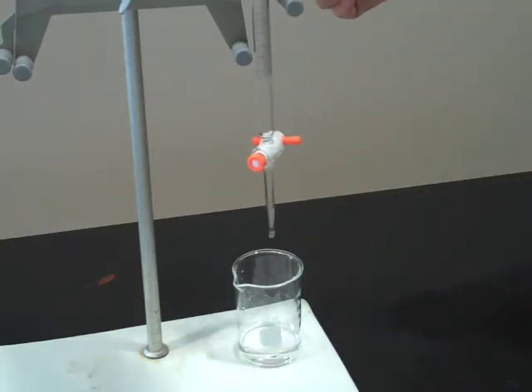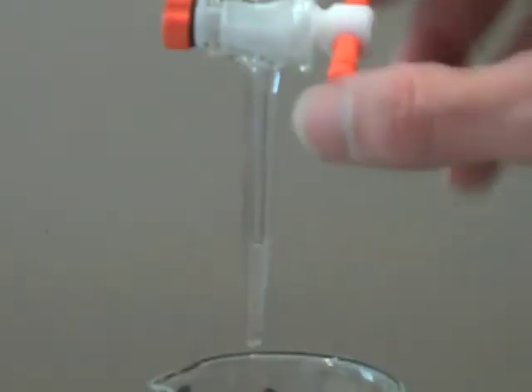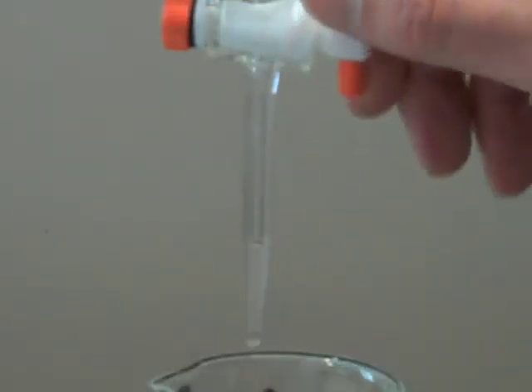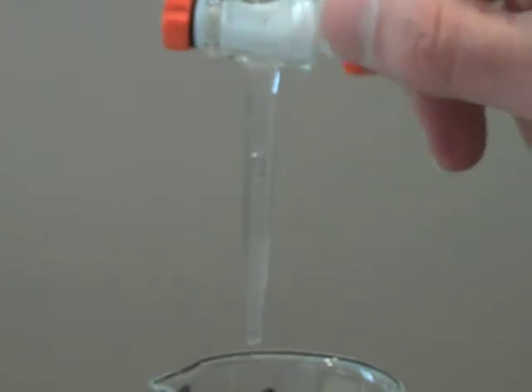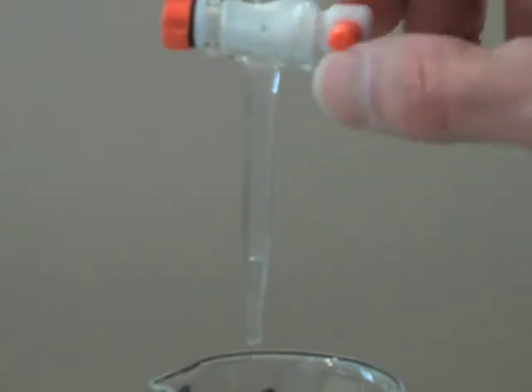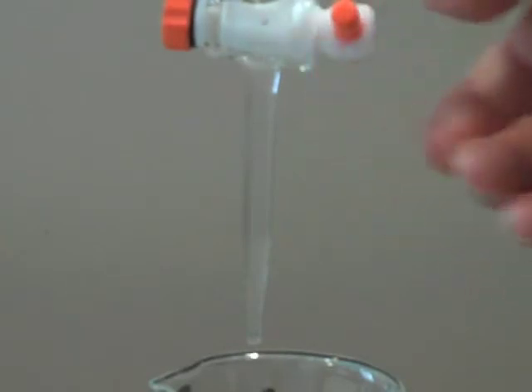Now refill the burette for the titration. Place a beaker for catching waste solution below the burette tip. Use several quick twists of the stopcock valve to introduce liquid into the bottom of the burette and coax any bubbles out of the tip.